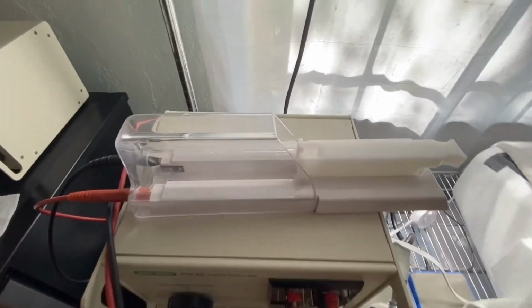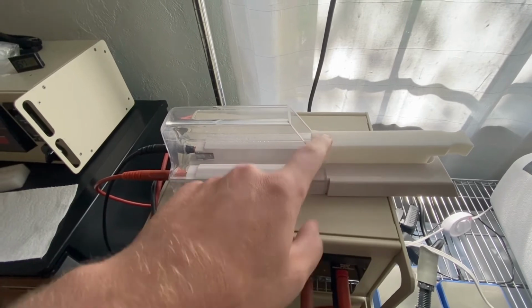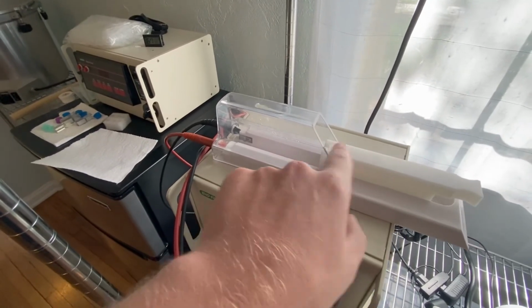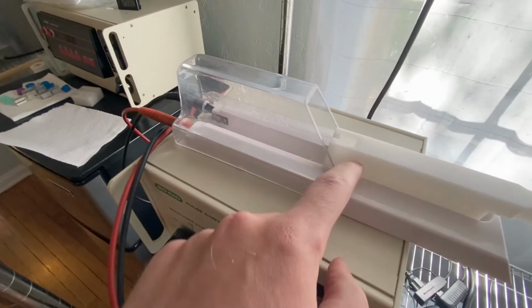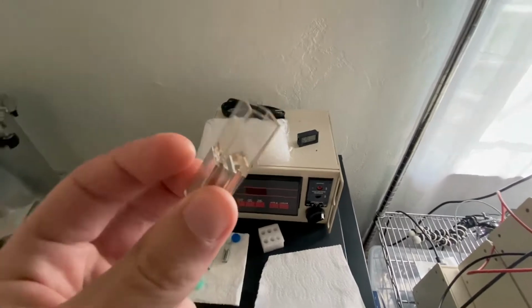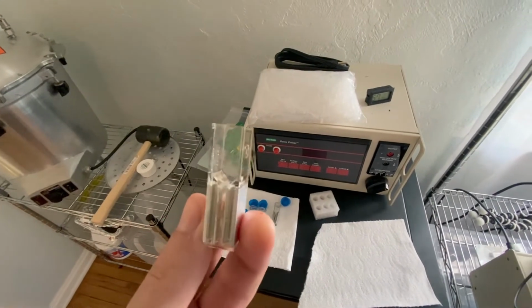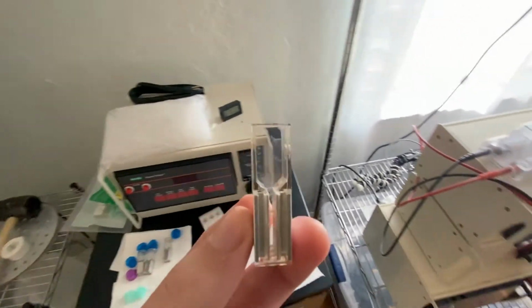And I was actually reading that waiting over a minute, just over 60 seconds, will cause the transformation rates to halve, which is pretty incredible if you think about it. So that's why every time you read, they always encourage you to do the recovery as quickly as possible. So I need to figure out two things. One is, what's the maximum amount of media that I can put in these cuvettes? And two, what are the right tools for putting those in there?